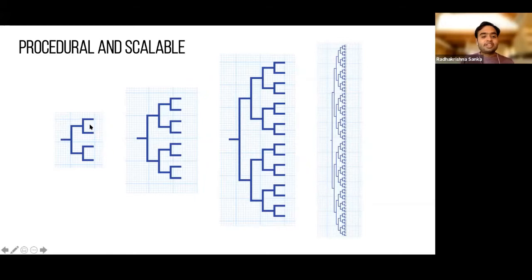So the one you see on the left is where a single channel breaks out into 4 different channels, right? Like a tree. That is kind of okay to do. But when you start making the next version of it, yeah, you can copy paste some of it and make some connections. But then as it keeps getting bigger and bigger, it becomes really hard to do that manually. And the one we have on the right is, I think, 64. And that is non-trivial. And let's say you want to change the channel width of this one, it's not going to be easy. But because everything we have is parametric and procedurally generated, we can easily modify this and it's super fast to do the changes.